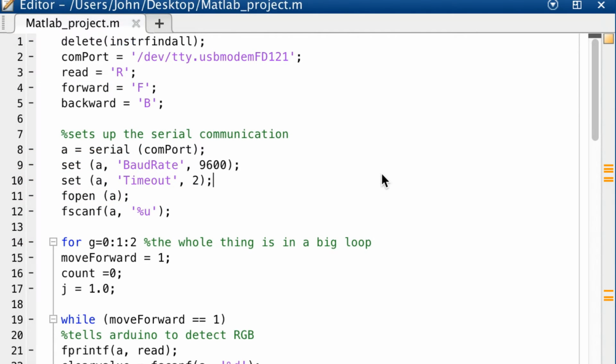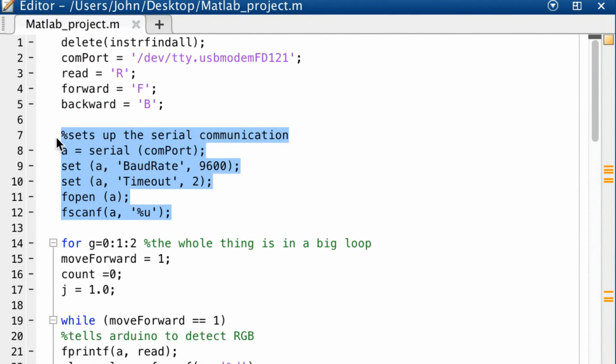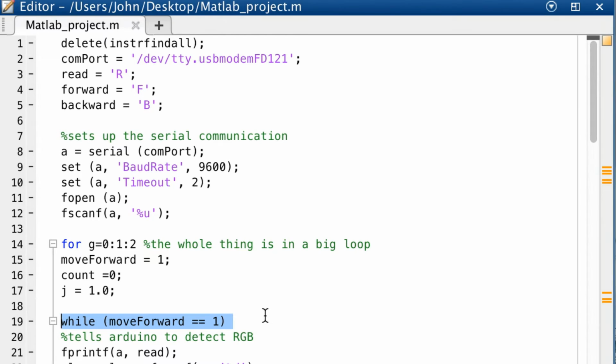This is an explanation for the MATLAB portion of the code. This first part of the MATLAB code is to clear all previous code from the Arduino and define global variables that would be used in the code. This part of the MATLAB is used to establish a serial communication between the computer and Arduino. Line 19 starts the main function of the code with a while loop. While we want the color sensor to detect a color, and if it is not the color we want, the motor moves forward by one step until the desired color is detected. This will cause the motor to start stretching the film, since the film is initially colorless.